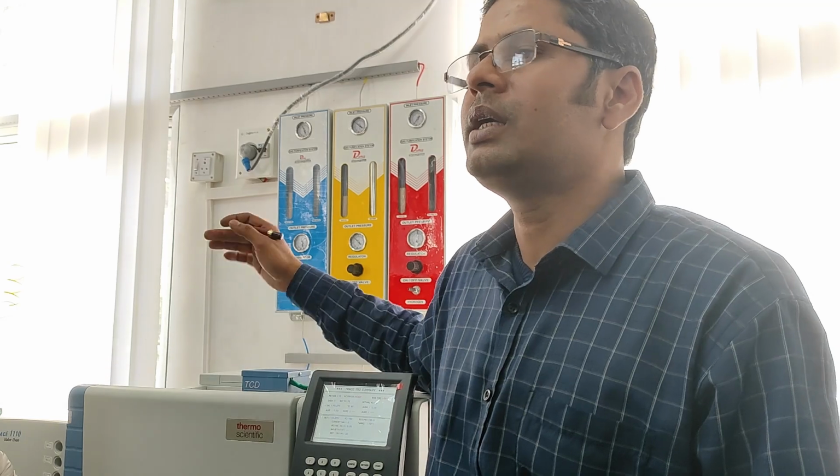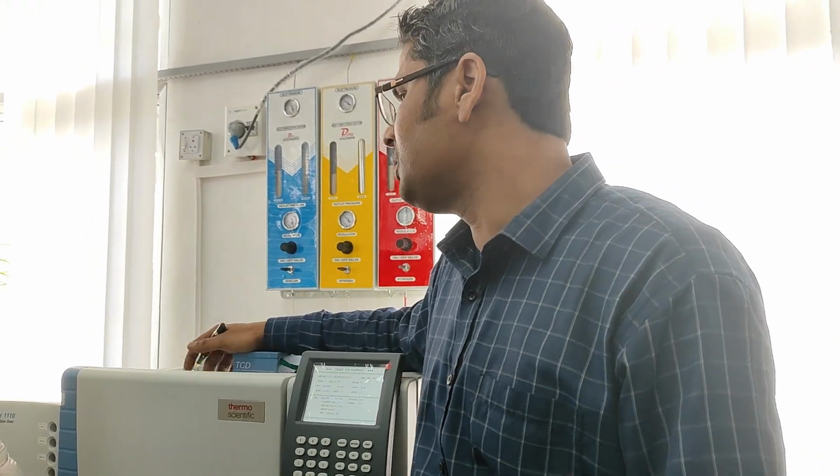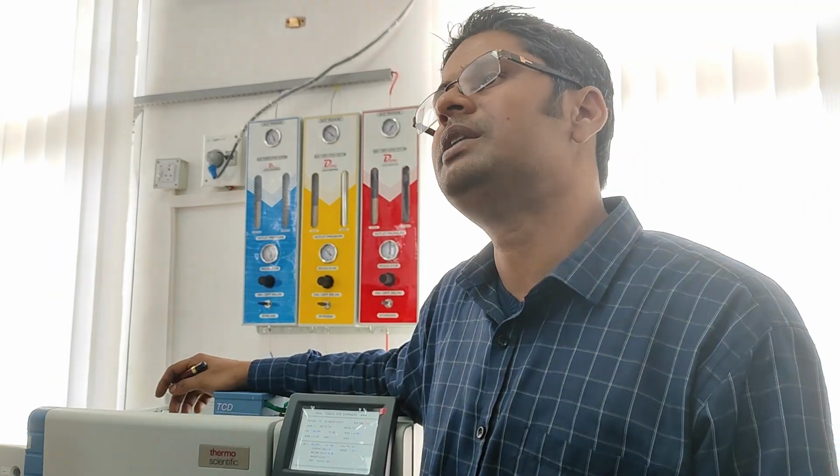If combustible gases are present, that means within a few months that transformer may blast. So they regularly check with the GC system. This is called DGA, dissolved gas analyzer. A GC used for refinery gas is called RGA, refinery gas analyzer. A GC for natural gas and LPG is named NGA, natural gas analyzer, LPG analyzer.